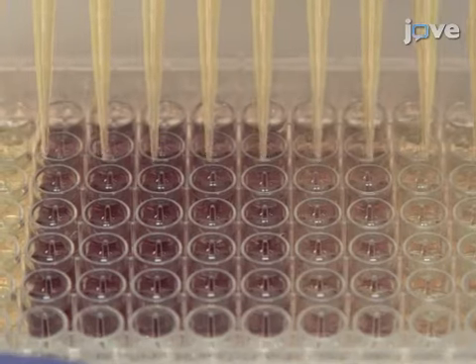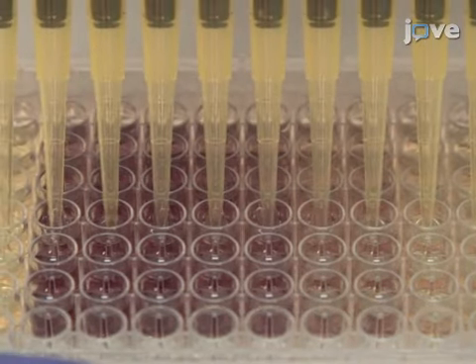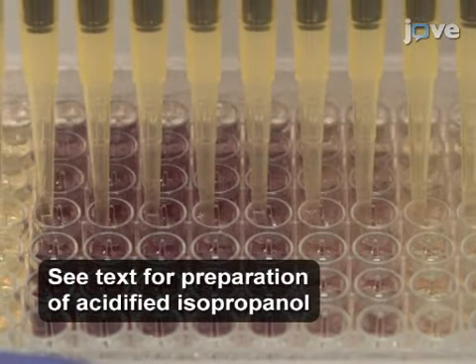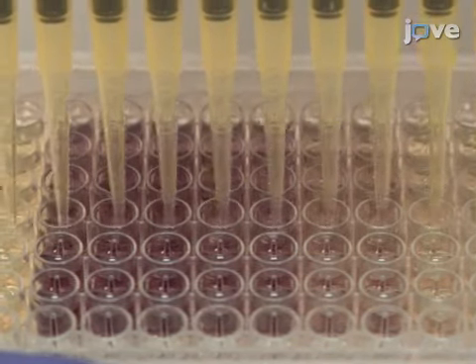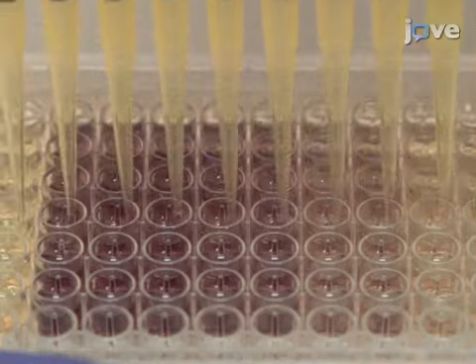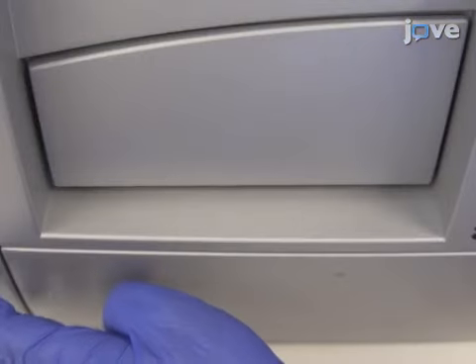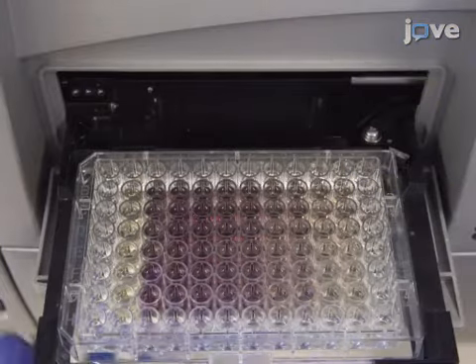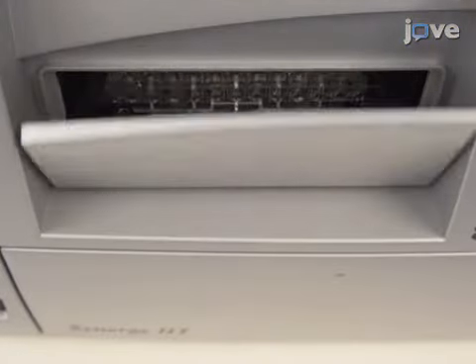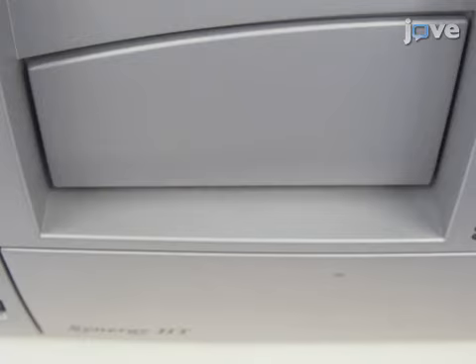Following incubation, make sure to thoroughly resuspend the formazan crystals as the absorbance values depend on proper solubilization of the compound. Add 150 microliters of the acidified isopropanol to each well and mix well with a multi-channel pipette to thoroughly resuspend all the formazan crystals. Using a microplate reader, determine the optical density, or OD, at 540 and 720 nanometers to ensure an accurate measurement by correcting for background OD.